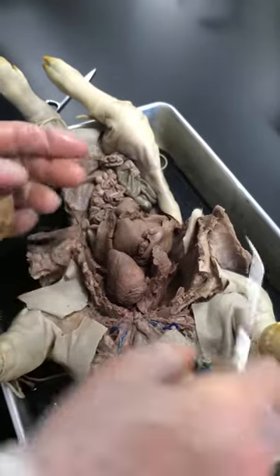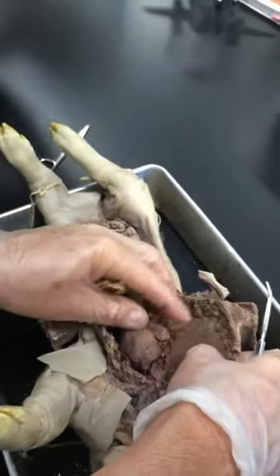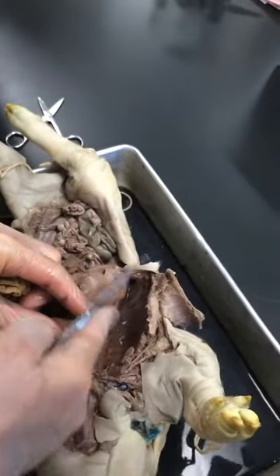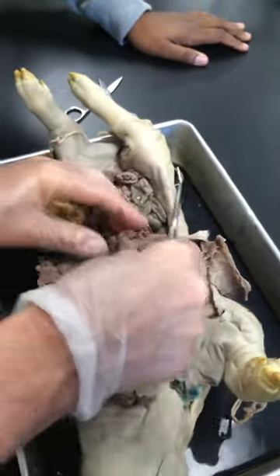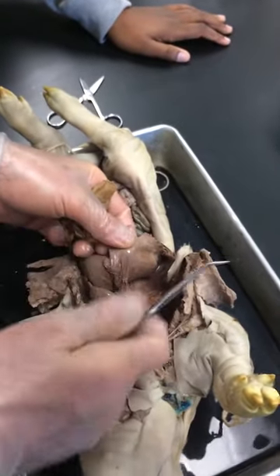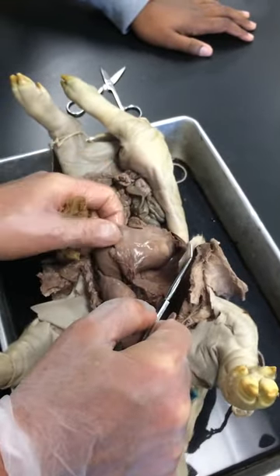Parietal pleura — now these you have to imagine. You can't really see them, but lining the pleural cavity where the lungs would be is the parietal pleura, and covering the surface of the lungs within the cavity would be the visceral pleura. Diaphragm is this muscle right here. It runs across the body in the transverse plane and separates the thoracic cavity from the abdominal pelvic cavity. It's also a respiratory muscle — very important.